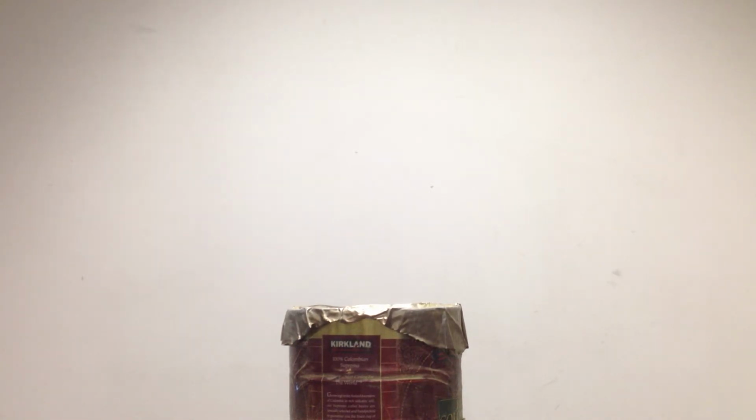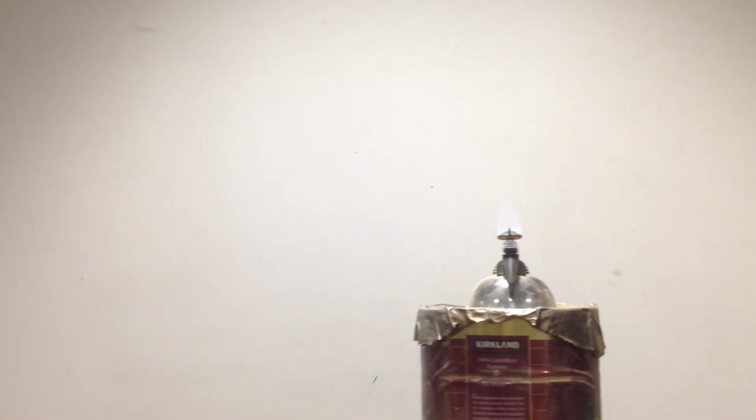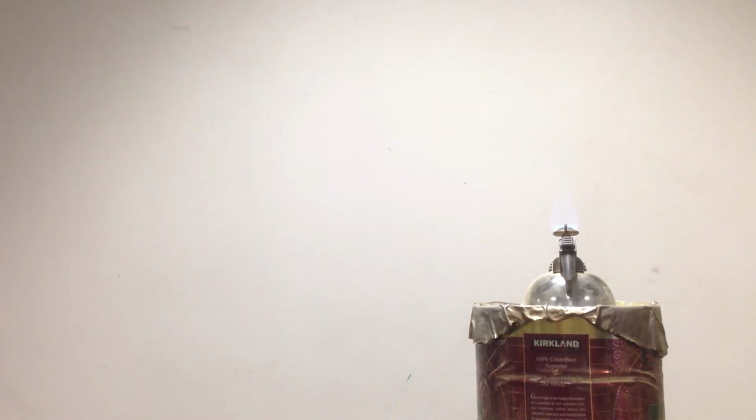So what I'm going to do now is take an alcohol burner, and I'm going to do something called dragon's breath, and I'm going to blow that same finely ground powder over a flame. And again, all I'm using is sawdust, nothing fancy here, and I'm looking for an incredible rate of reaction as I blow that powder through the flame. And again, the rate of reaction is going to be much faster than when I lit the clump of sawdust, only because I'm now exposing more atoms to the reactive oxygen. And when the oxygen is exposed to more of the cellulose of the powder, we have a faster rate of reaction, only because we've increased the surface area.